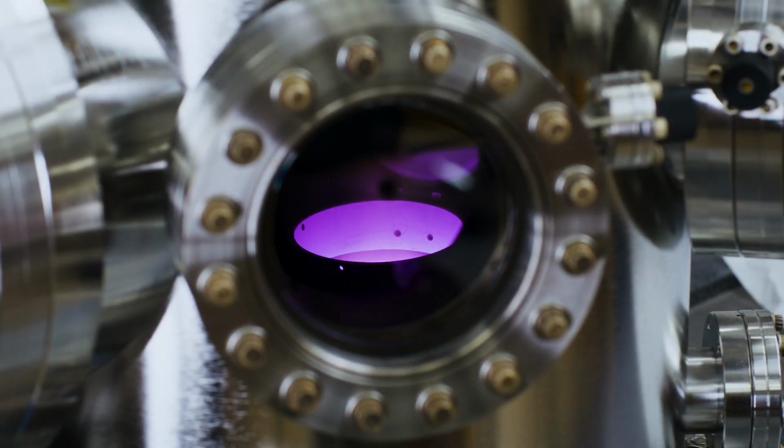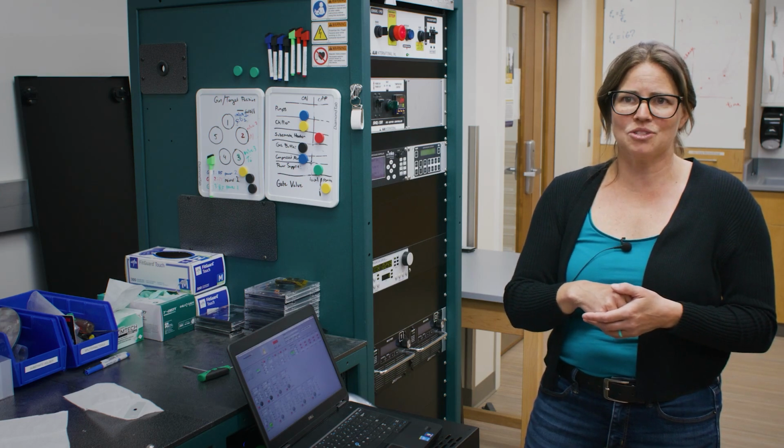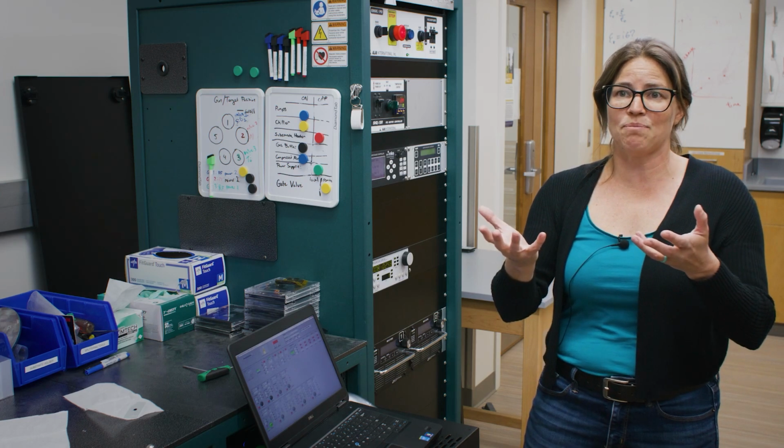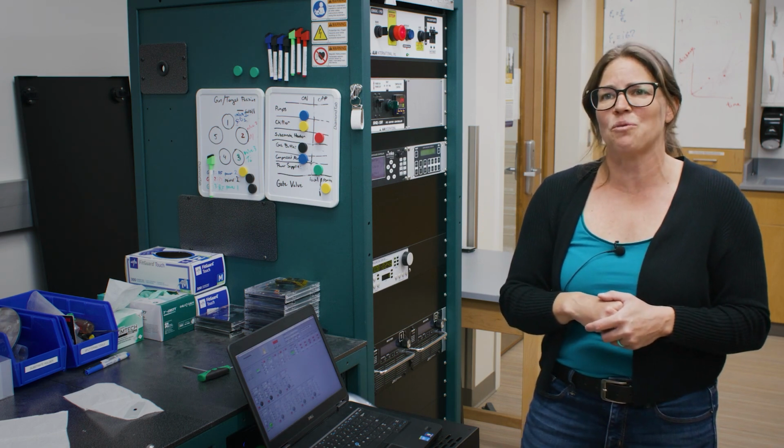And that was the sound of the shutter opening, and you can see the plasma inside the chamber now. This will now run for about 3 minutes of a deposit. Once it's done, the tool will ramp down the power so that way we can safely turn off the power supply, and our deposition will be done. At that point, we can turn off our vacuum pumps, let the whole tool come up to atmosphere, and then we can take out our sample and see what it was that we made.